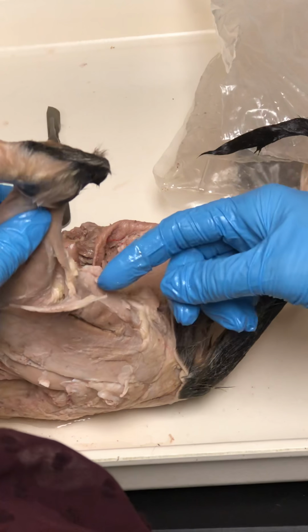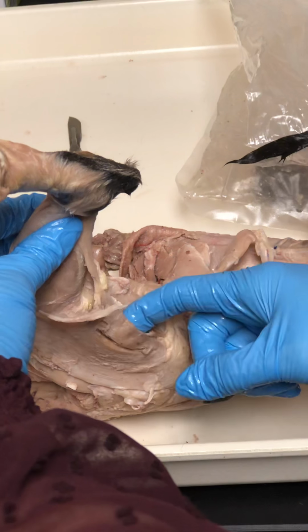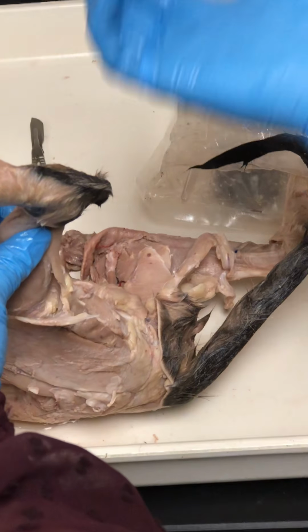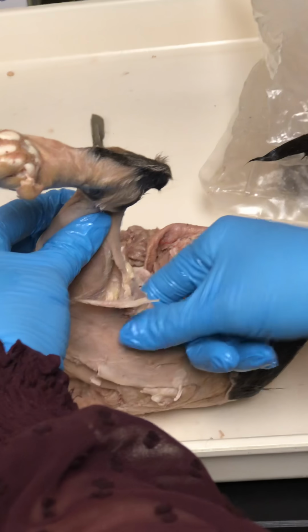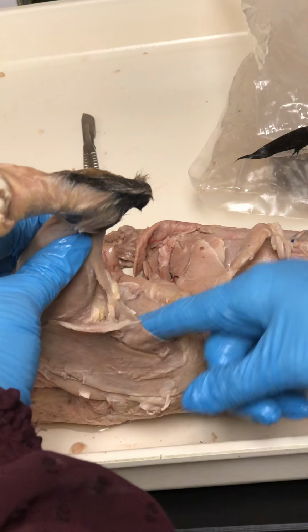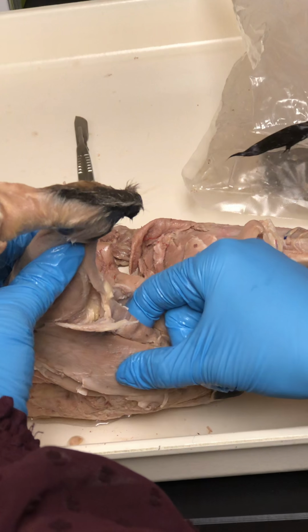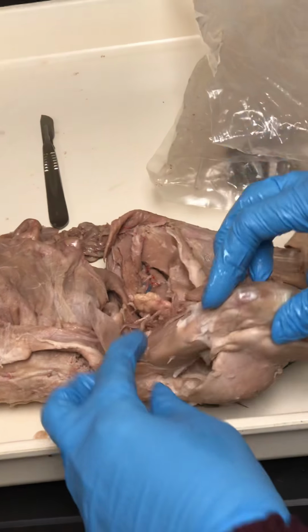Vastus lateralis. Okay. Here, let me jump to this one real quick. The other side of the hamstrings, the lateral side, is your biceps femoris. Okay? So just like your biceps brachii that flexes the elbow, your biceps femoris, one of the large hamstrings, flexes the knee. So same idea. So you've got semimembranosus, semitendinosus, the smaller one, and then biceps femoris here. Okay. Now, and then what was the one you were headed to next?